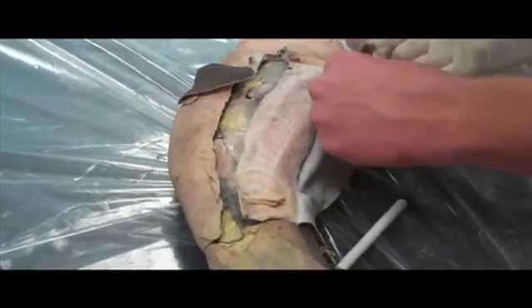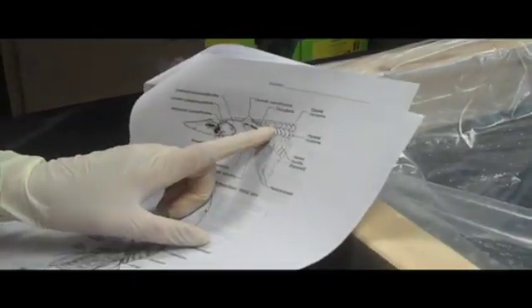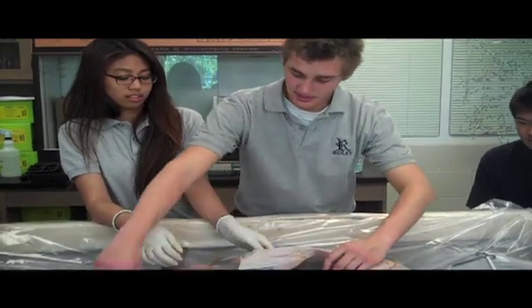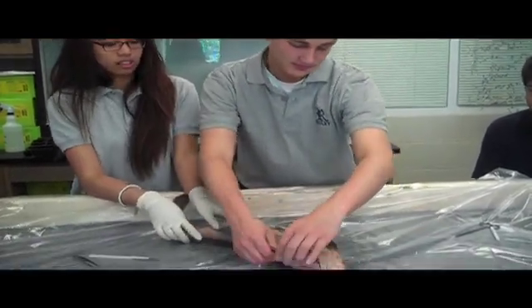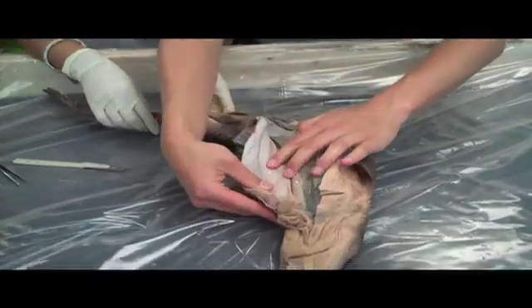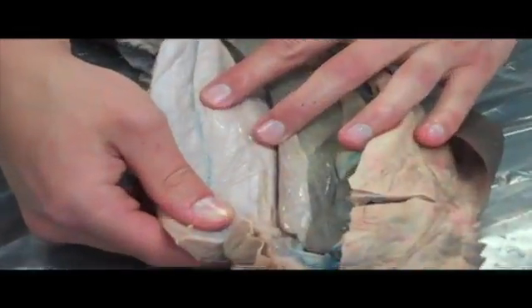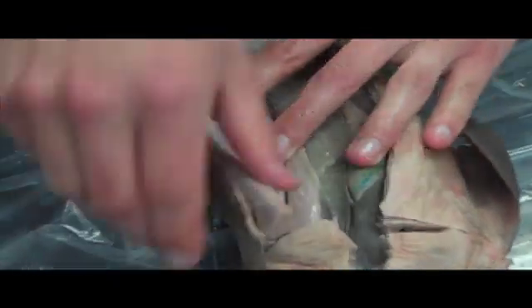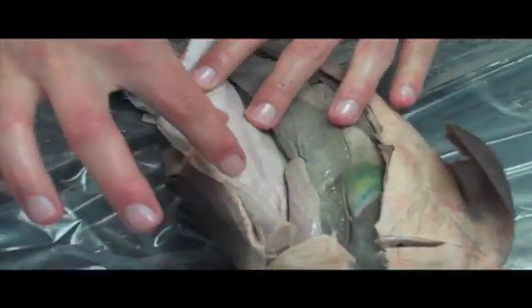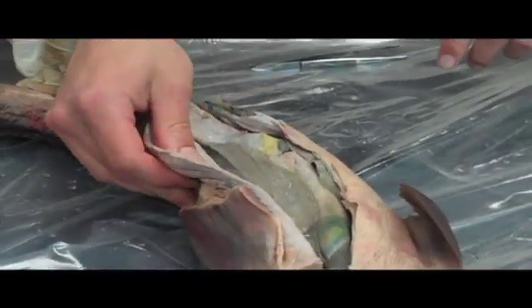Those are the ventral bundles of the hypaxial muscles. There are different little compartments, or little divisions, so to speak. Like here, like in many other fish, these basically allow the shark to contract certain muscles at a time, so that it can get the wavy, swimmy motion in the water.